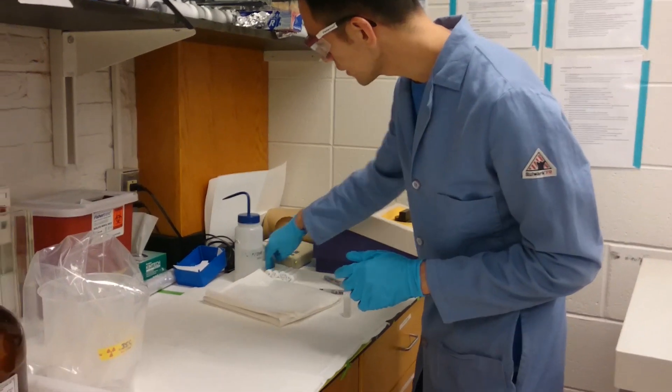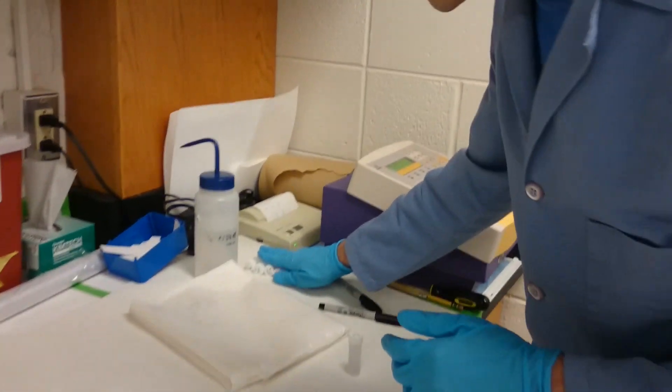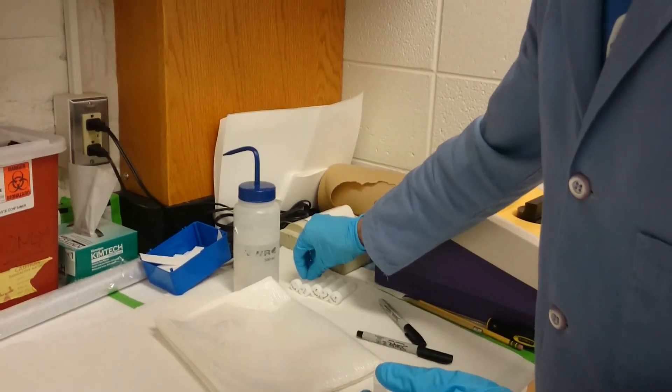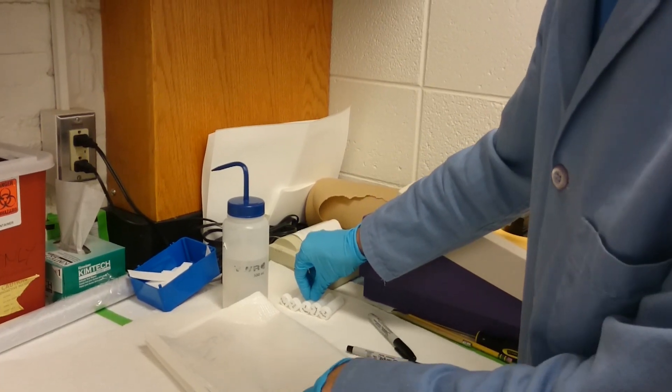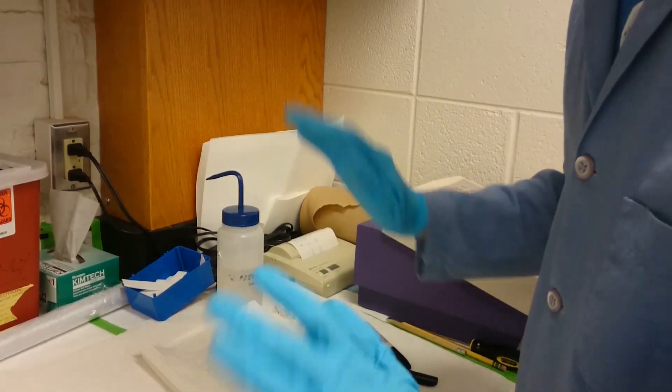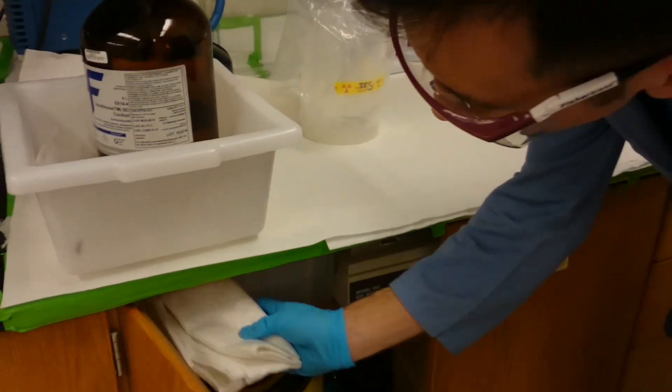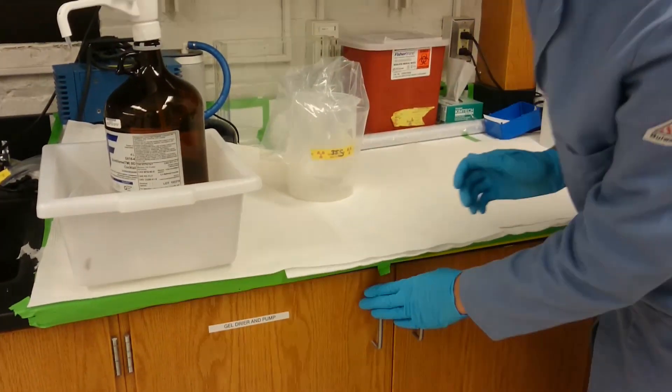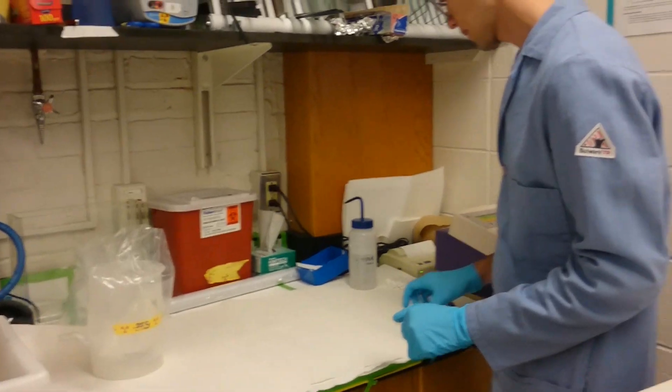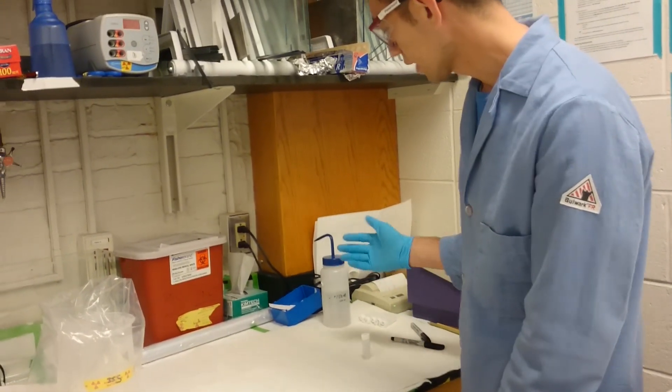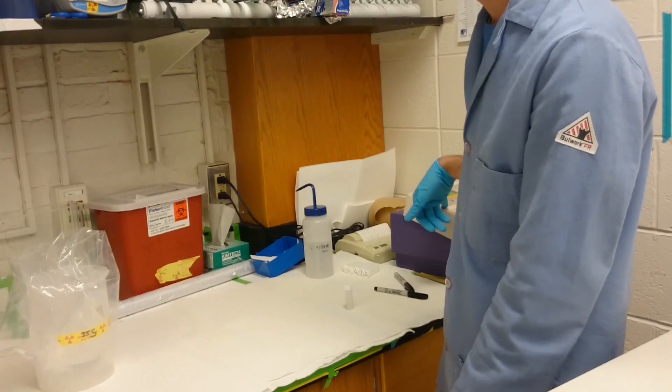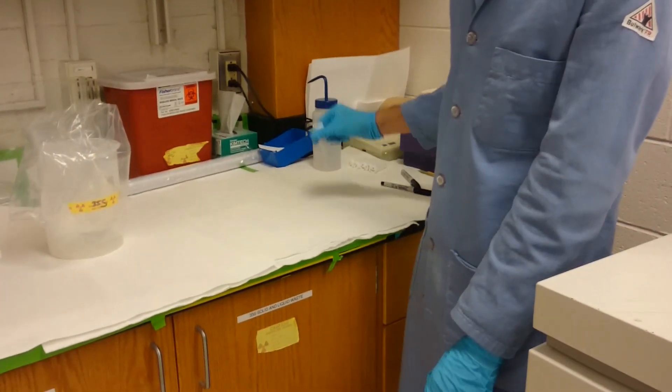At this point I've checked the pipettor, the working mat that I was using, the bench, and my coat. So far everything is fine. So I'm going to put the mat back in the cupboard, and then finish off by reading my shoes and then reading the floor.